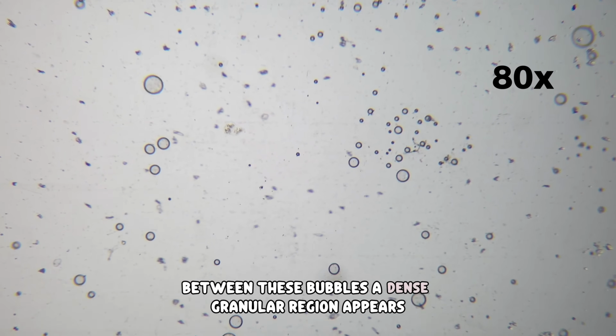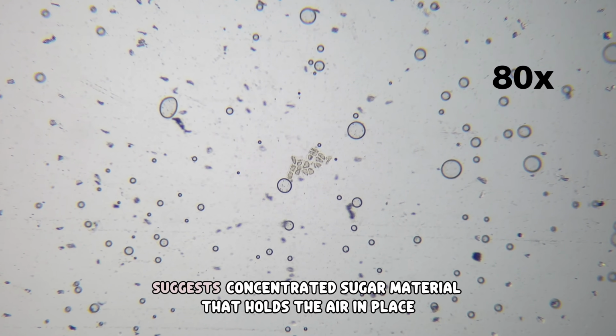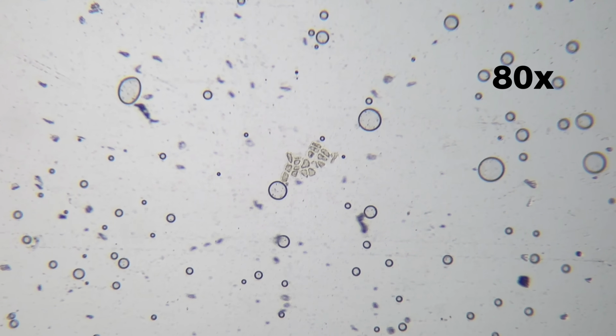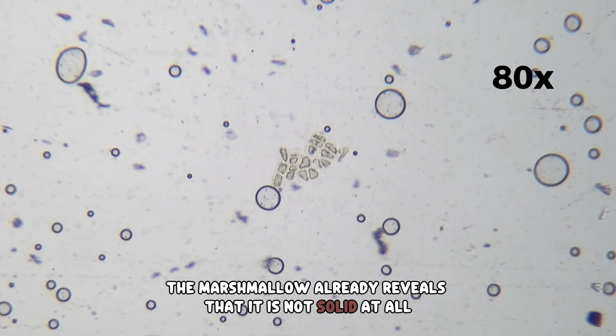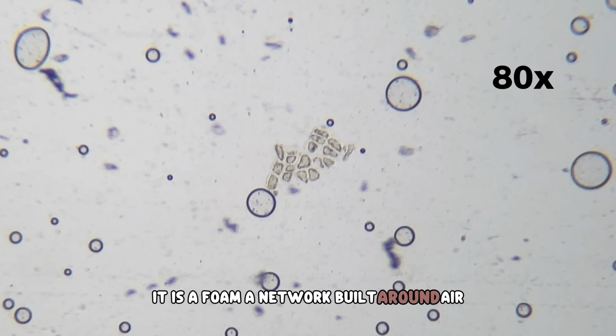Between these bubbles, a dense granular region appears. This darker mass suggests concentrated sugar material that holds the air in place. Even at this early magnification, the marshmallow already reveals that it is not solid at all. It is a foam, a network built around air.